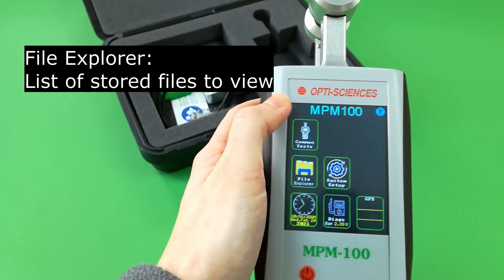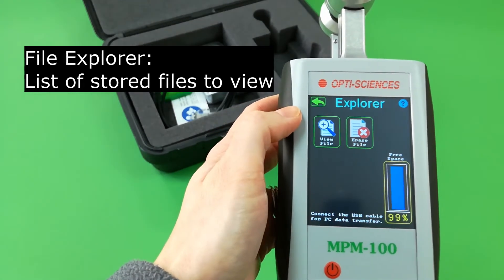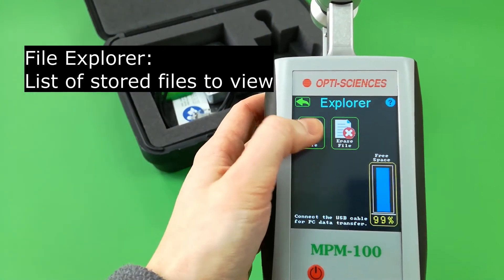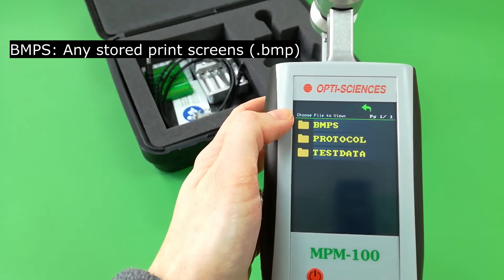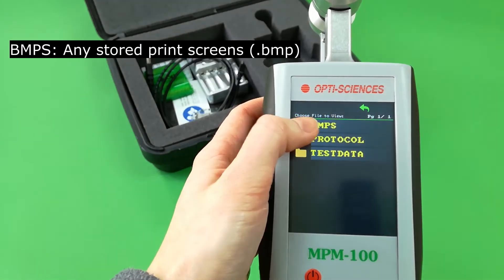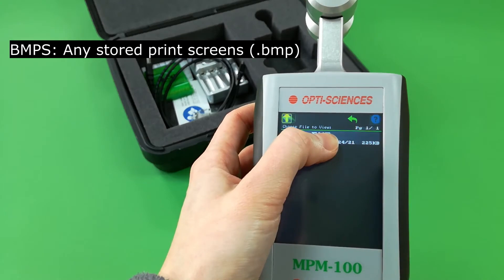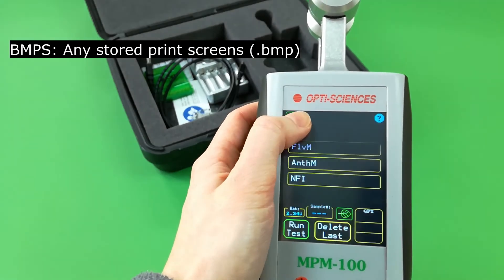Use the back arrow to return to the home page. File explorer displays a list of stored files to view. BMPs are stored print screens. Return to home page.